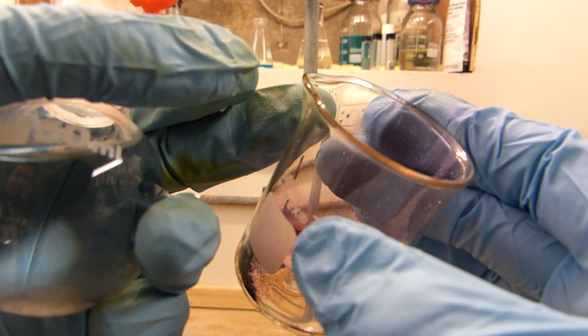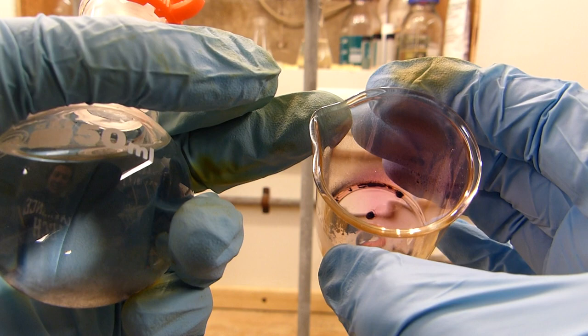Sort of a black tinge, but more importantly on the edges of the beaker. See all the shiny crystals? That is resublimed iodine.